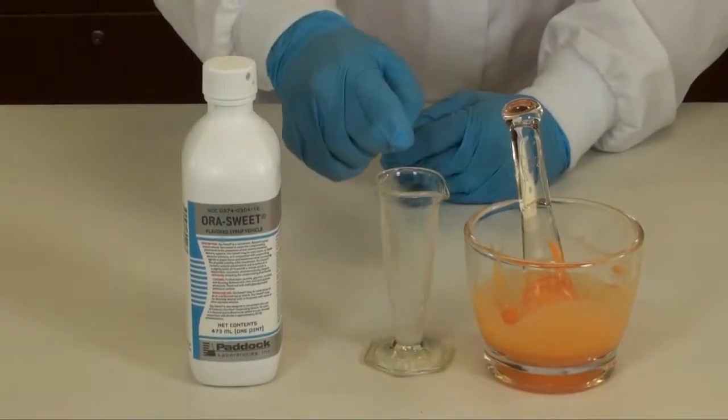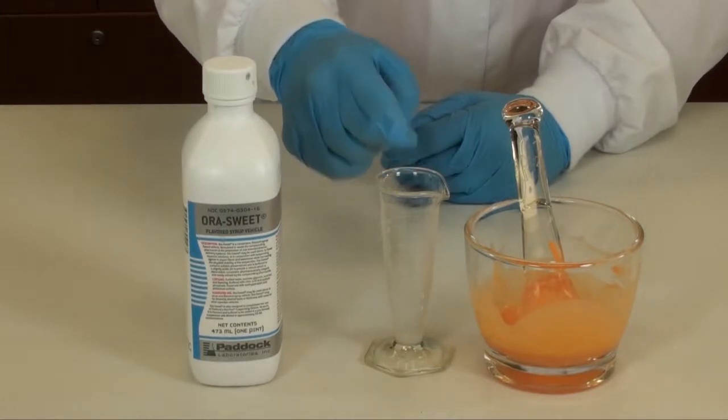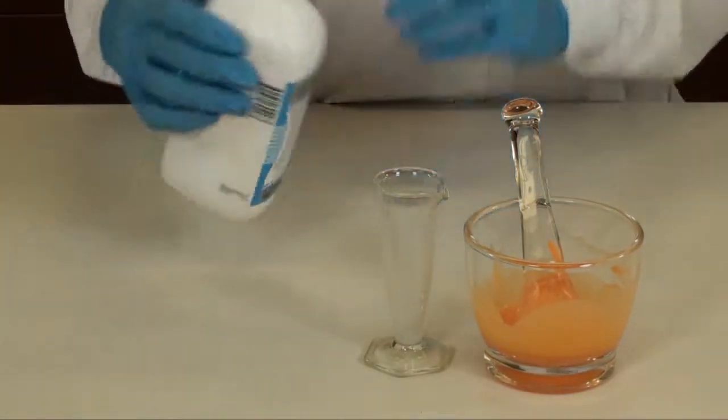You can now use the same graduated conical to measure your sweetening agent. Today, we're using ORA Sweet.